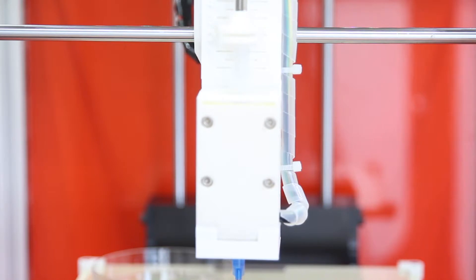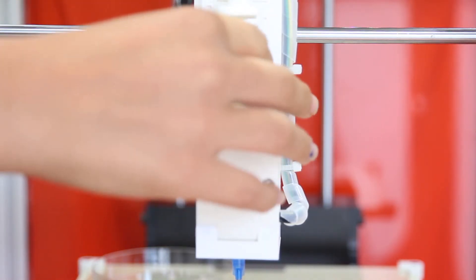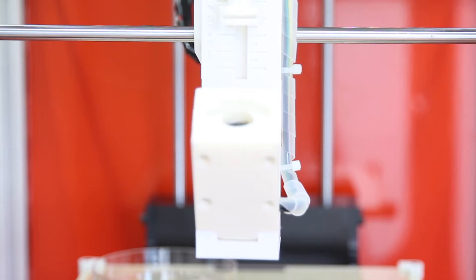Once the first print has finished, you can unload your calcium chloride syringe and load in your alginate syringe.